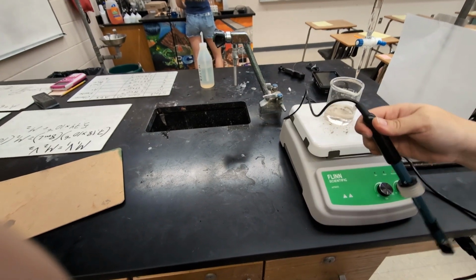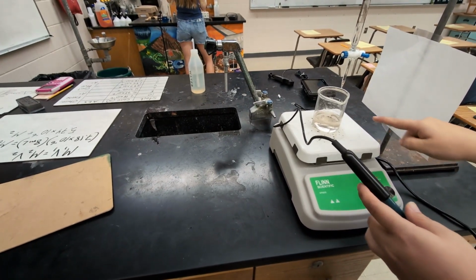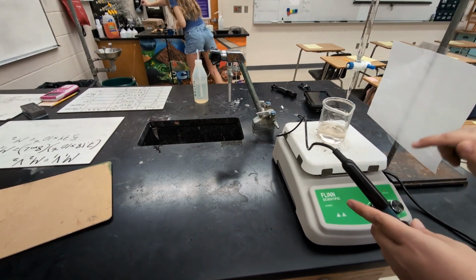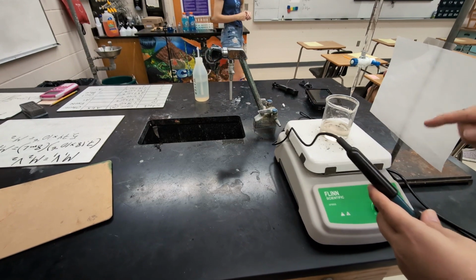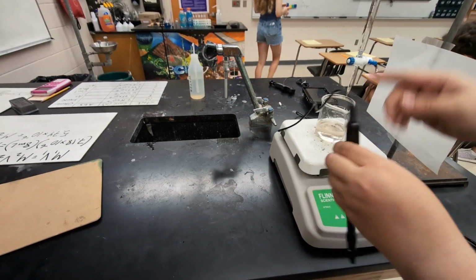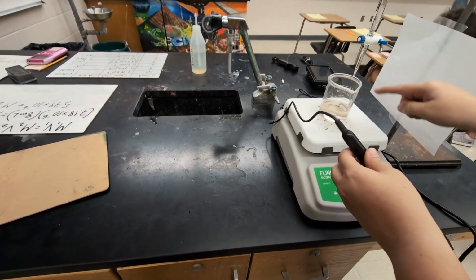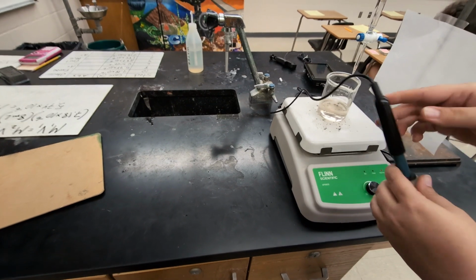Okay, so for this titration, I have our unknown ammonia solution in the beaker. We're using a beaker today instead of the Erlenmeyer flask. Typically, you'd want to use an Erlenmeyer flask so there's less chance of a splash. But in order to get the pH meter and the burette both have access to the rim of the solution there, I use a beaker for this.